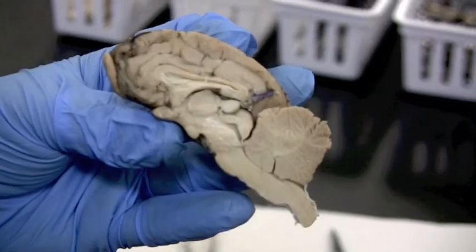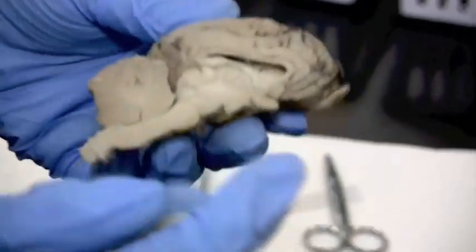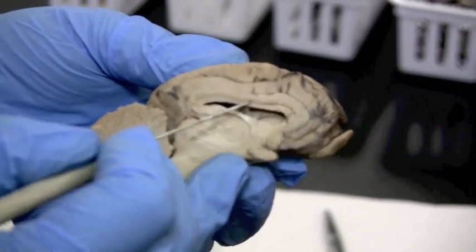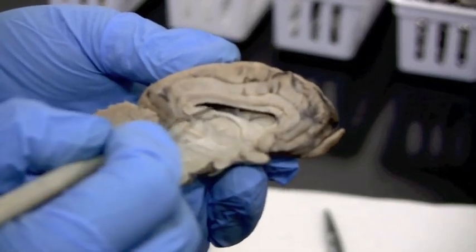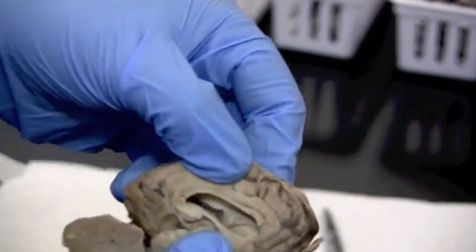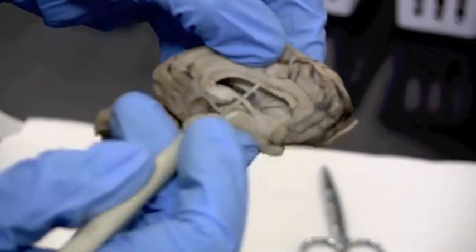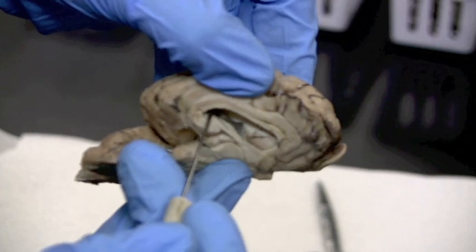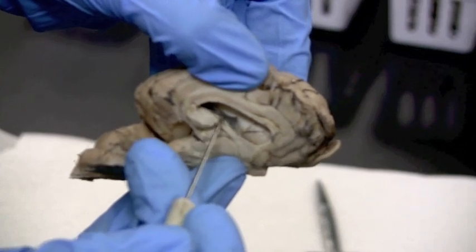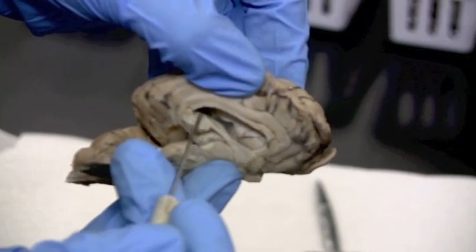Looking at the other half of the brain, you can see the corpus callosum and then the open chamber — that's the lateral ventricle. Pulling it apart gives a really clear view into this ventricle. That dark, pigmented tissue in there is part of the choroid plexus — specialized ependymal cells that produce the cerebrospinal fluid. You'll find those in certain areas of the ventricles, and this is a really good example.